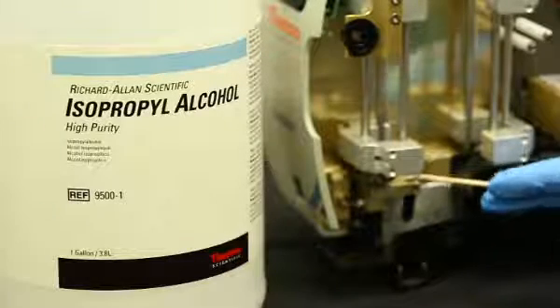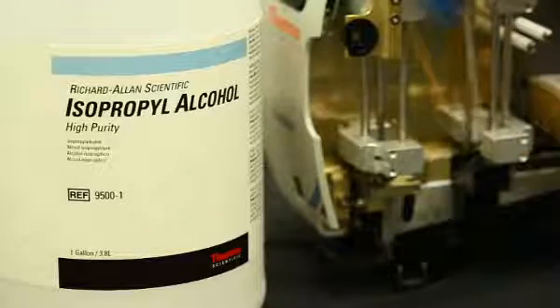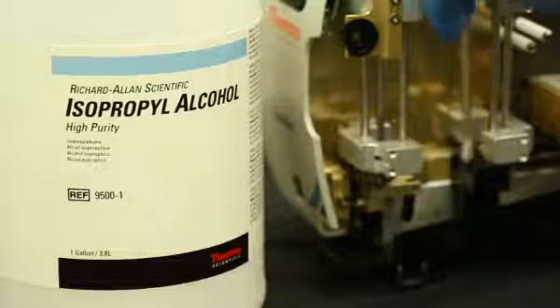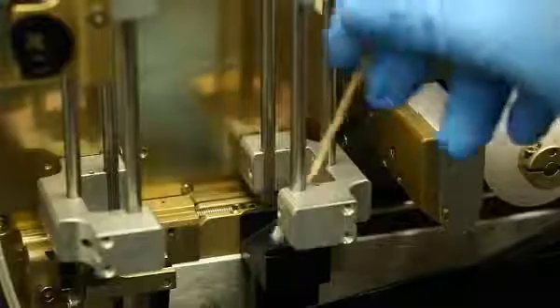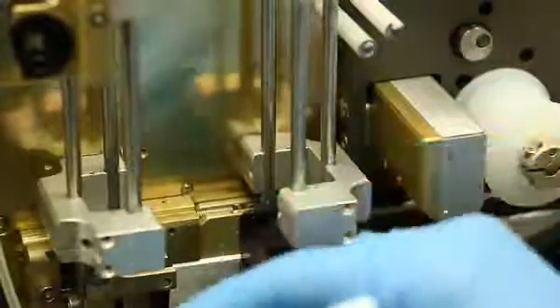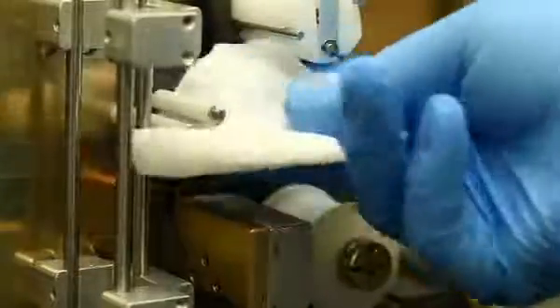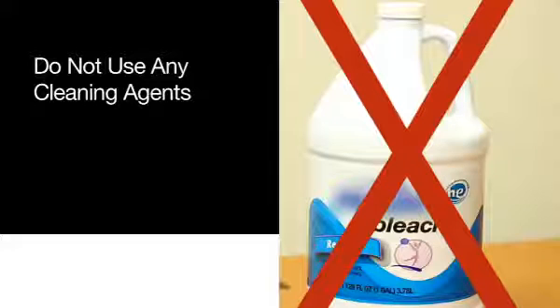Q-tips may be used to clean in spots hard to reach. Dip the Q-tip in some isopropyl alcohol and reach for the spot where there is dust. Discard the Q-tip after use. The two horizontal rods can also be wiped clean, but with a clean cloth or paper towel only. Do not use any cleaning agents, as that will also remove the lubrication.